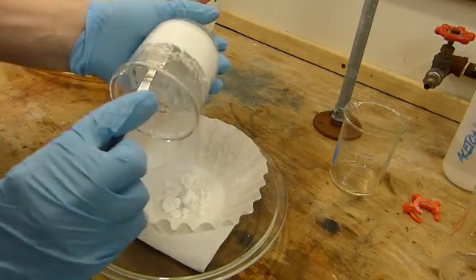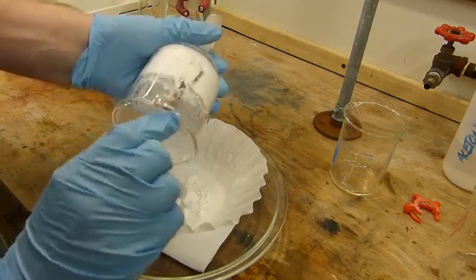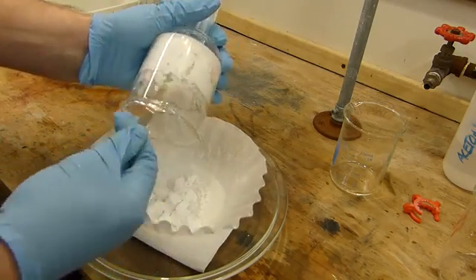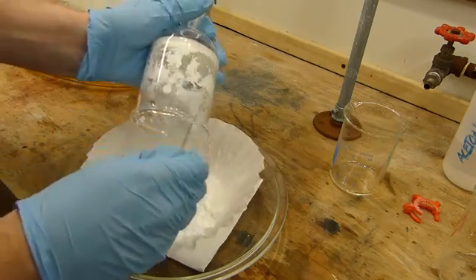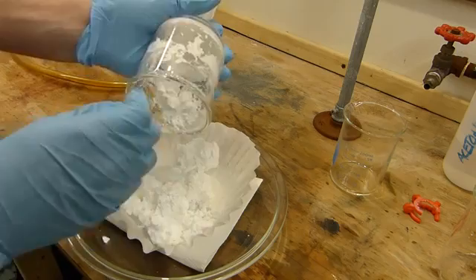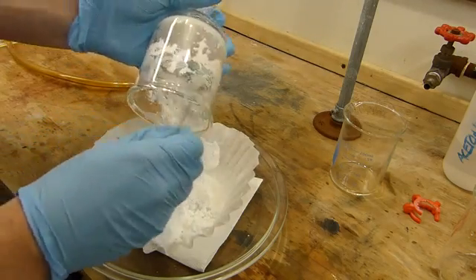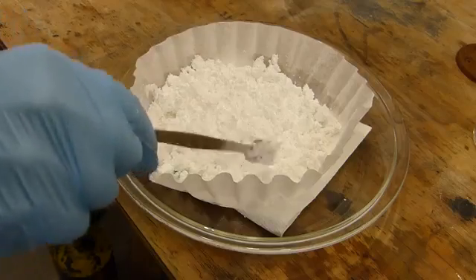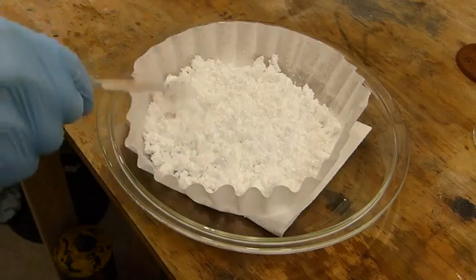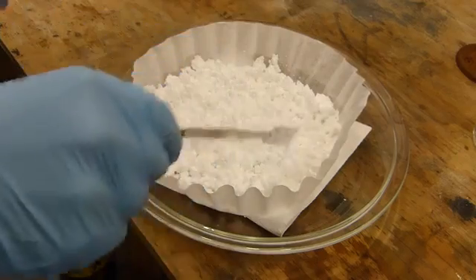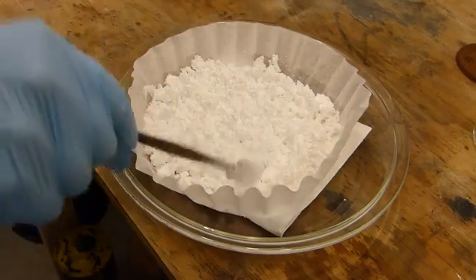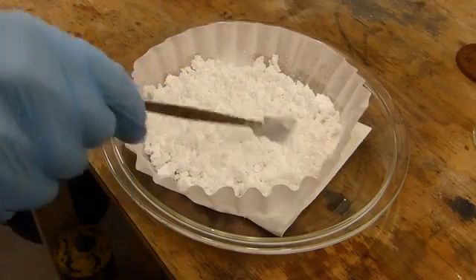That's not going to work. It's crunchy. It feels almost like wet snow. Very, very interesting texture. And we'll just break up as many clumps as possible and spread this out as evenly as possible. Allow the paper towel to suck the water out of it. And then we can change out the paper towel periodically to make sure that this dries nicely.